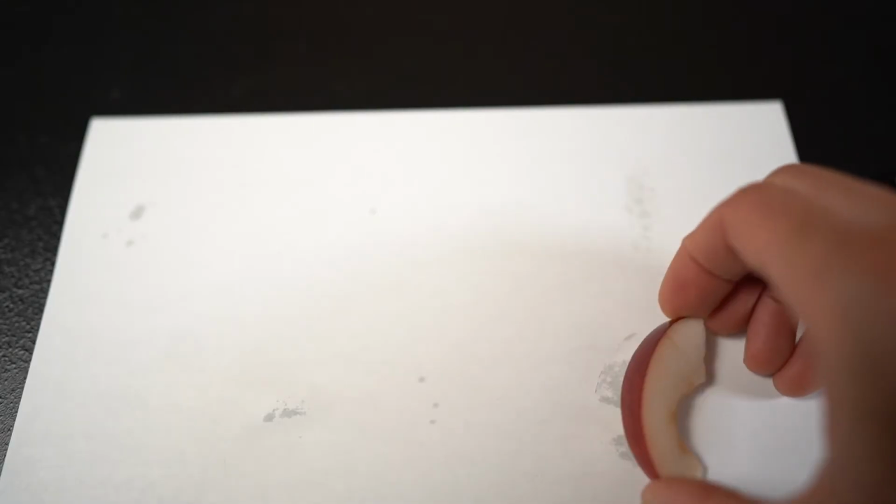So you're going to see that that part of the plant is going to be a negative starch test in general because it's meant for an animal to eat. It did show us a positive fat test, but it's not fat. That's just the moisture from the apple going on that piece of paper. If you let that paper dry out a little bit, you'll see that that stain disappears, but the greasy stains remain.